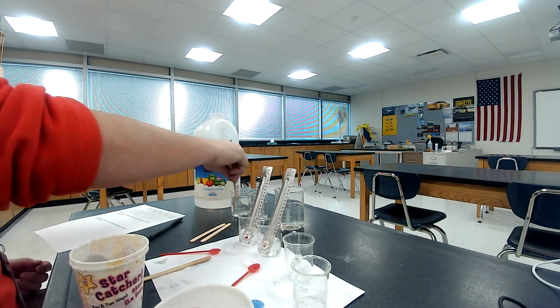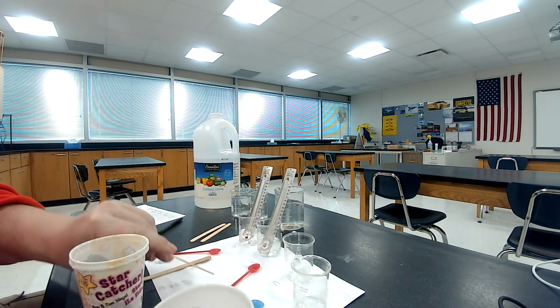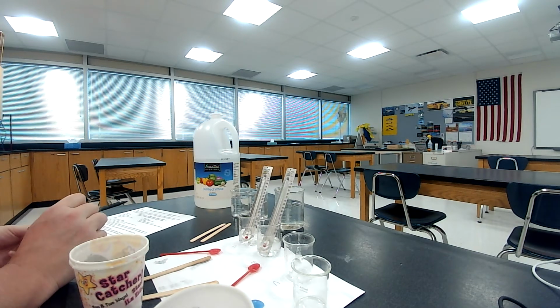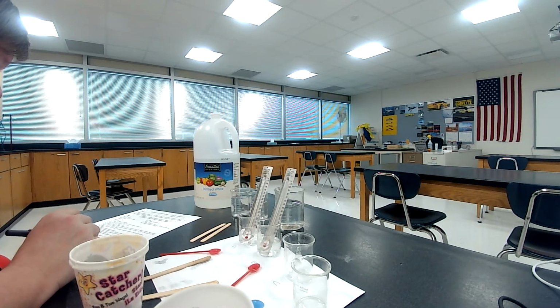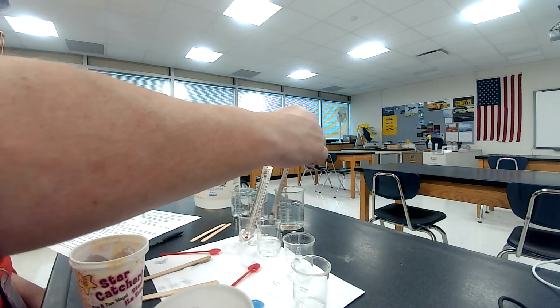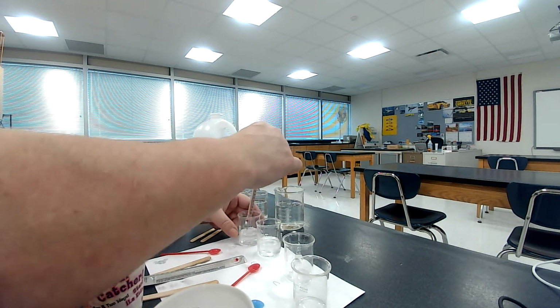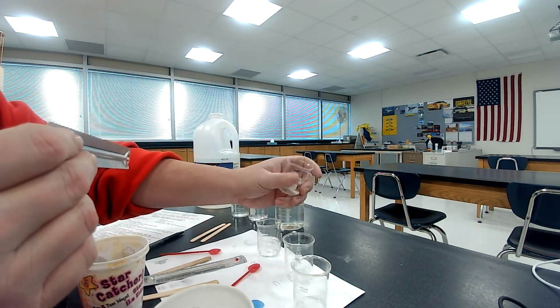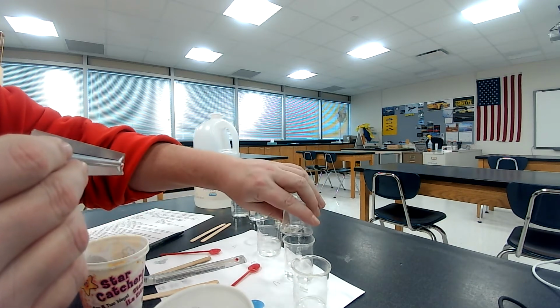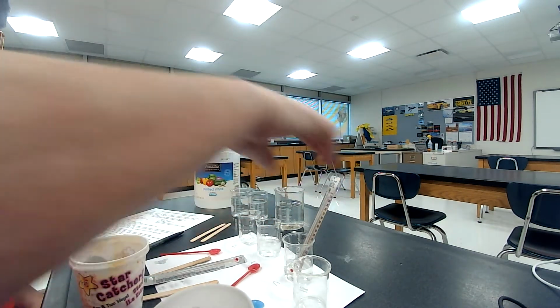I'm going to rinse this stick. Okay, I'm going to dry it off over here. Perfect. Okay, and then what I'm going to do next is, it says for number 12, next pour all the contents of beaker A into beaker C. All right, so this is beaker B. I'm going to keep this thermometer with B. So it says take all of this A and pour it into C. So I'm going to pour it into C right here. Okay, put the thermometer back in it.